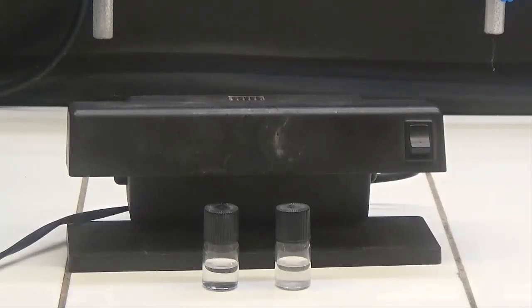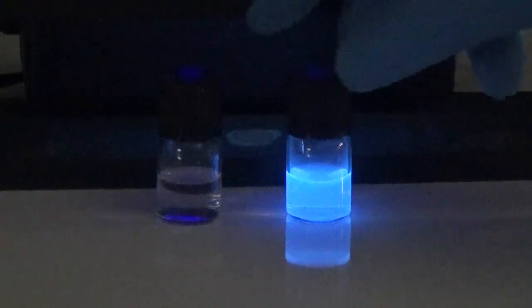These are irradiated with ultraviolet rays and the fluorescence of the vial containing hymecromone can be observed.